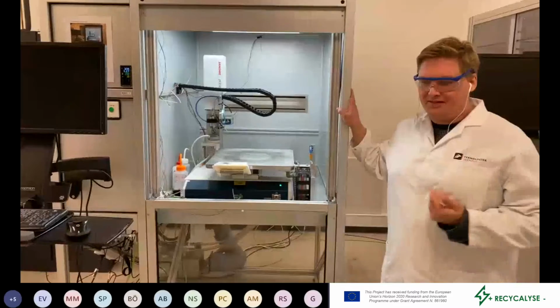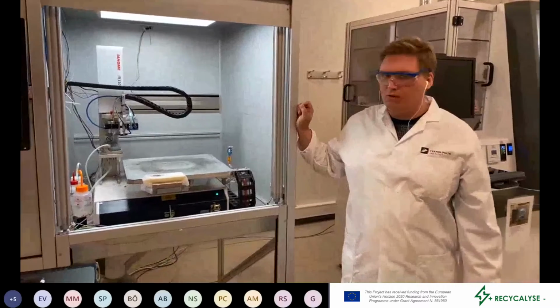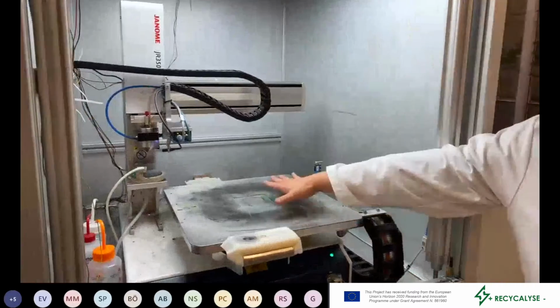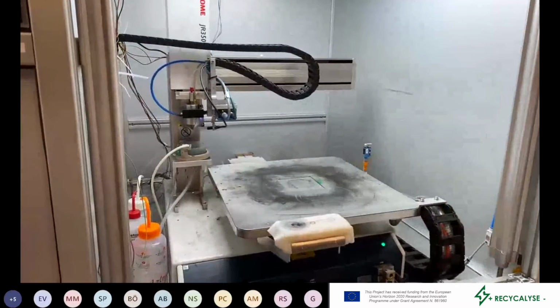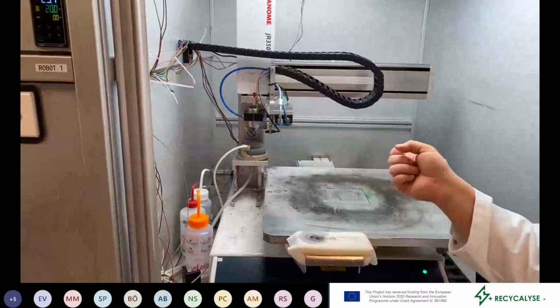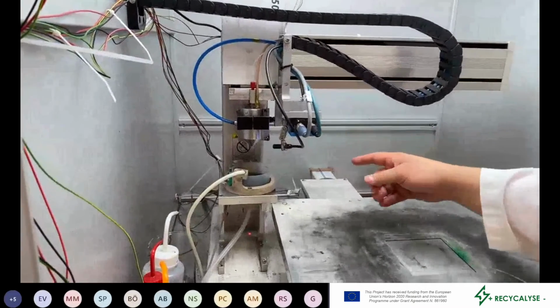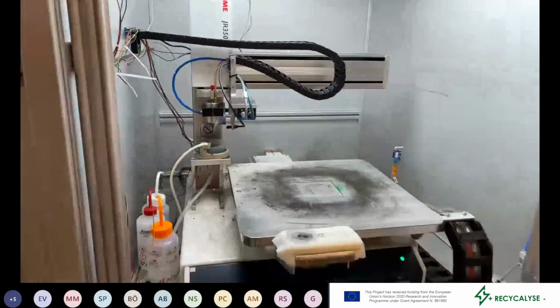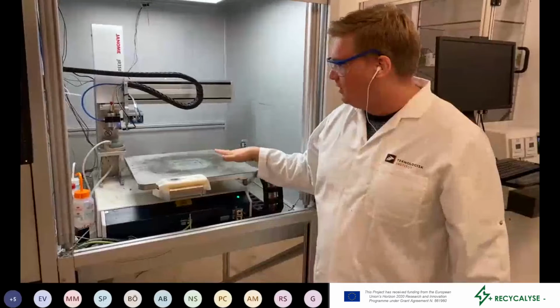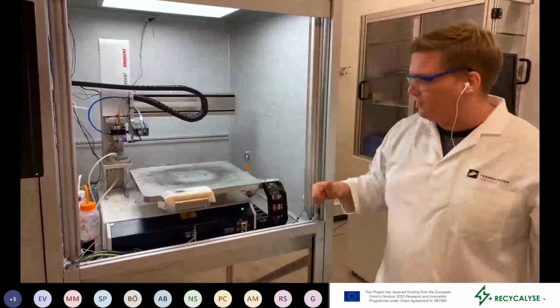This is one of our spray deposition robots. So we have a semi-automated system for doing spray deposition. We have a hot plate with a vacuum suction, and then we have a sonic spray head, and we have different cameras for visualizing, and there's also a laser in the back, so we can do an automated process where you deposit a layer, and then you can photograph it and look for defects.